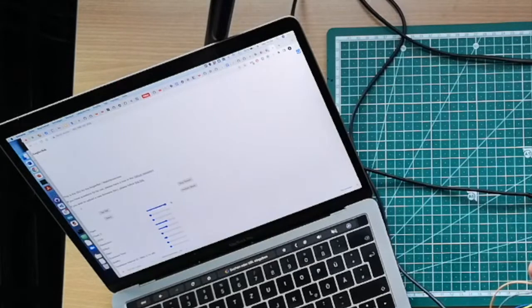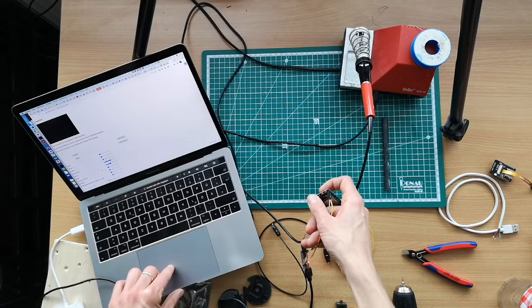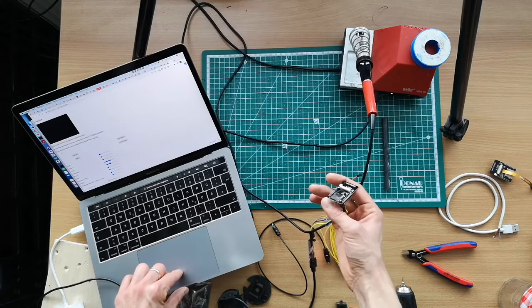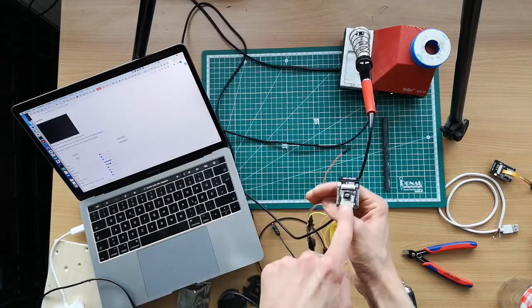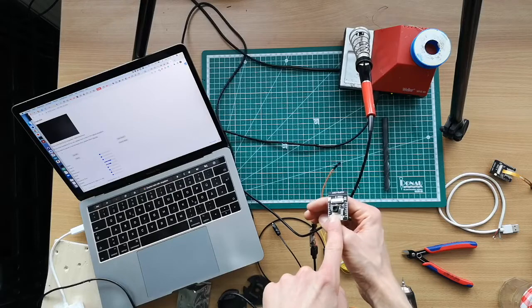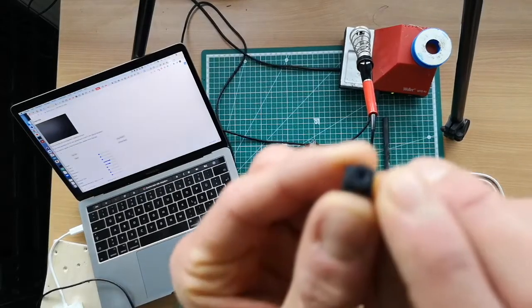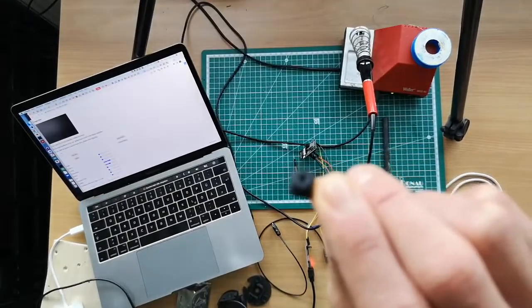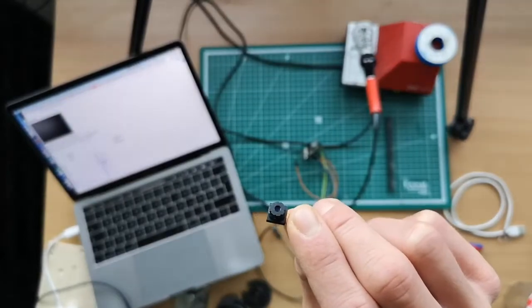The flash eventually will pop up, I can also turn it down. There's also the opportunity for a lens, which is not connected yet. And I think the stream is just overexposed, so that's why we don't see anything. Now it should work. Also the gain should be 0. And then you can play with the settings. For example, now the exposure time is set to some reasonable value. Also, you see that we already unscrewed the lens, so this should not be the default. The default looks rather something like this here, where you have the camera lens still inside the camera assembly. Well, I don't really see that. We unscrew one later so that you see how that works.